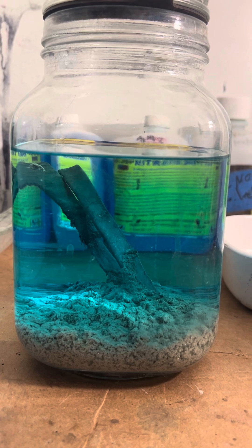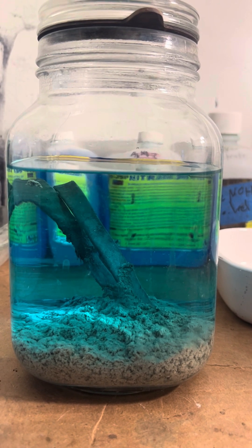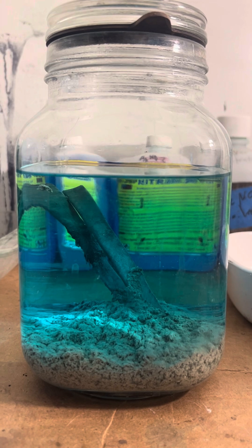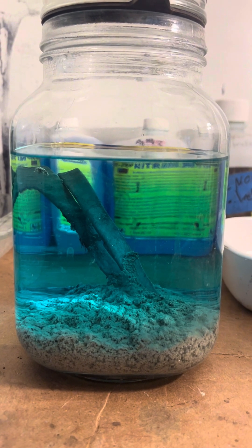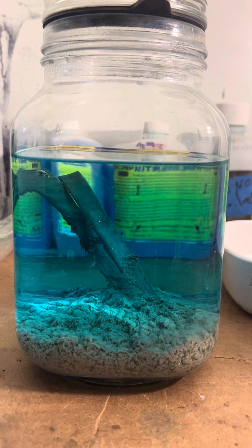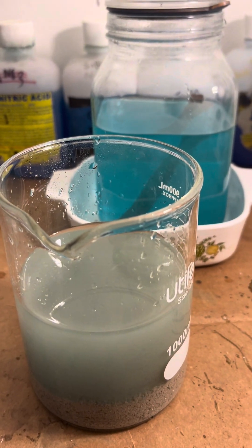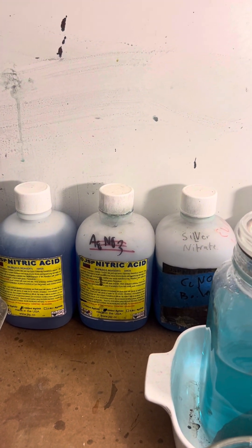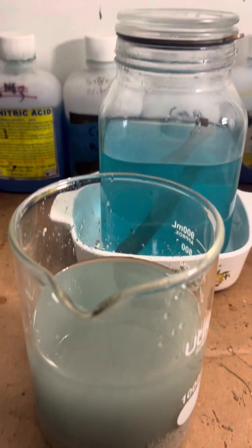This is our results of the cementation. It's been in there for 24 hours. The silver nitrate has turned into copper nitrate — the silver has fallen out and the copper atoms have gone into solution. That's why it went from silver nitrate to copper nitrate. This is the cemented silver pulled out of the silver jar. I return the copper bars to the copper nitrate to pull any remaining silver out, and we'll reduce this down to store with the rest of the copper nitrate. Then we will use that for electrolysis for another project involving the silver salt.